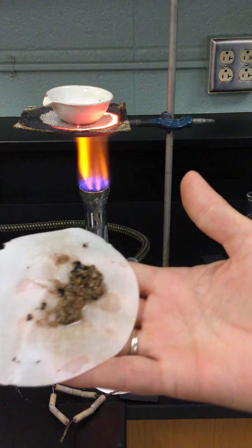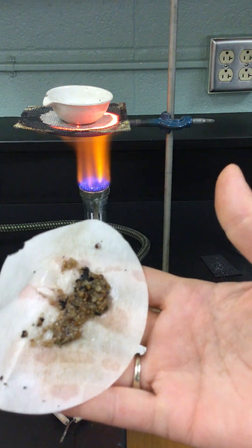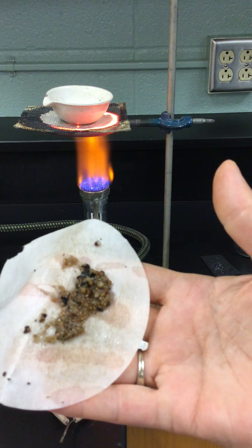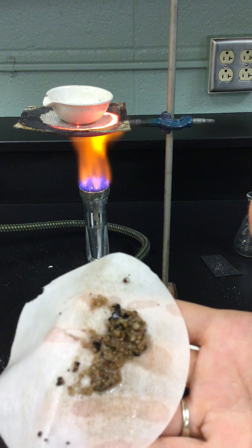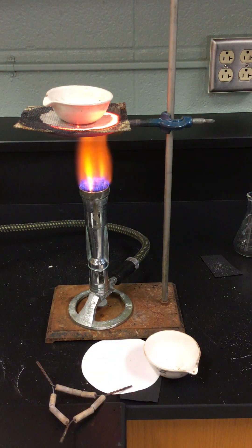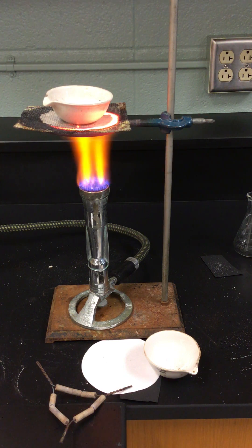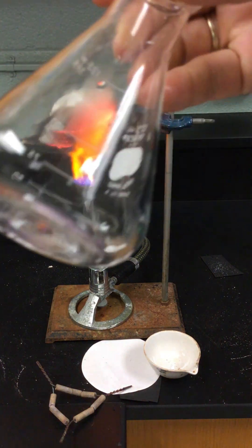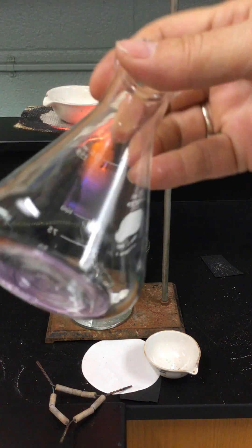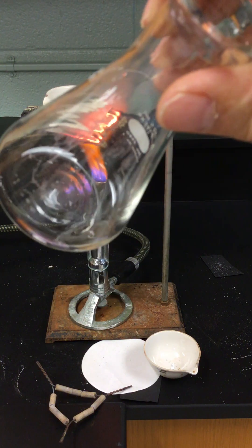Don't try this trick at home. There's the filter. So not much sand came through, like zero sand came through. The sand remained on the filter. And you can see here's the Erlenmeyer that we had the filtrate in. There's absolutely no sand in here whatsoever.